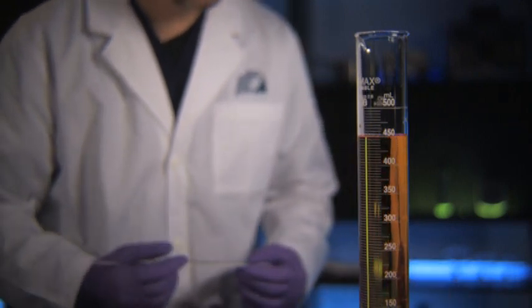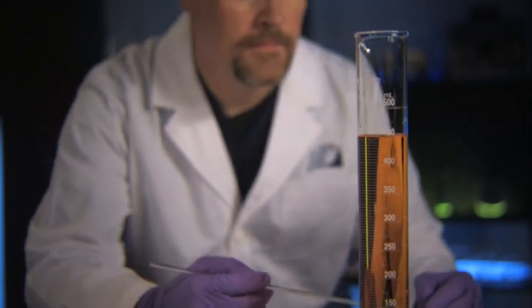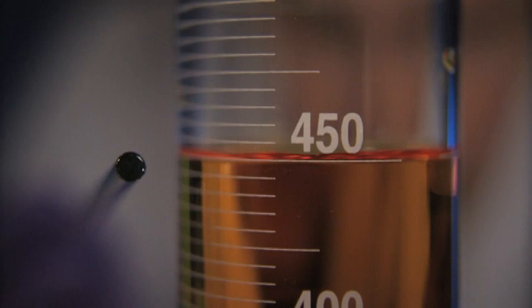To read the meniscus, place the container on a flat, stable surface to ensure the surface of the liquid is level. Crouch down to eye level with the surface of the liquid and align the lowest point of the meniscus surface with the nearest graduations on the side of the container.